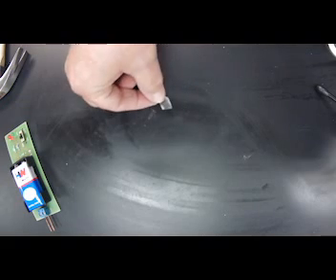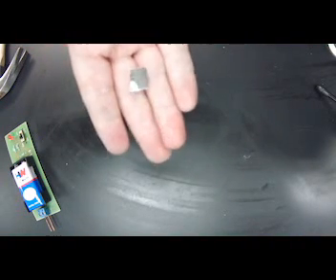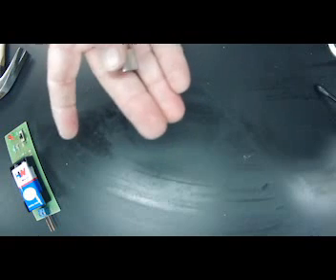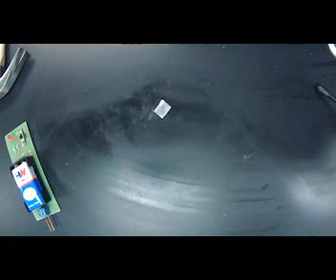And our last one we're going to talk about is going to be zinc. So zinc is a flat sheet here. It is very shiny. It's very lustrous. Again, it's like tin, a gray kind of color. All right, so last thing is result of tapping.